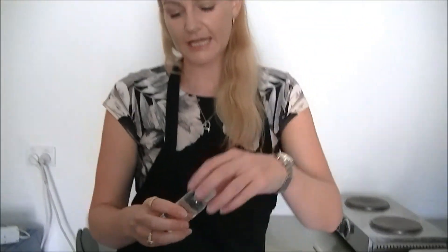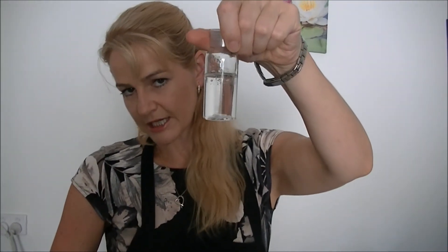But you'd cover that in plastic wrap, come back the next day. And this is actually what you'll end up with. This viscosity and this clarity. It will be this clear. Now, that's not to say that all surfactant samples you create will be this clear. But this particular formula will end up that clear and will end up that viscous. So again, when you make a sample today, you'll need to cover it in plastic wrap and come back and evaluate it the next day to see what it's like properly.